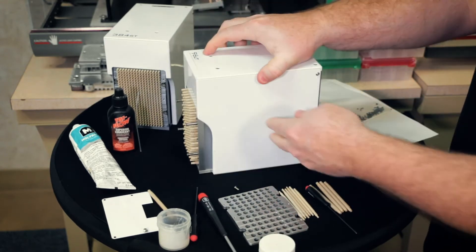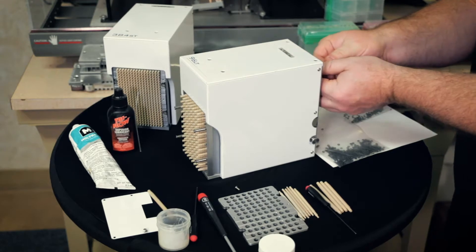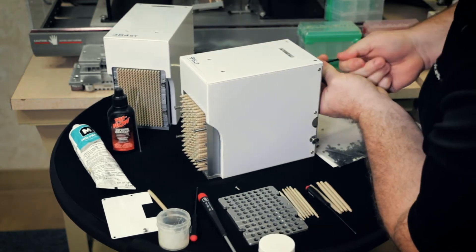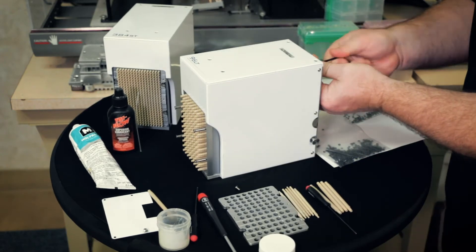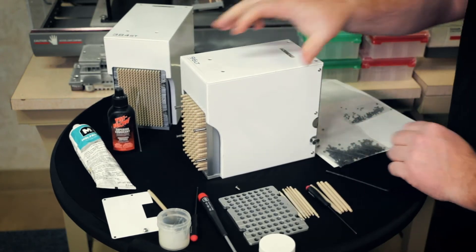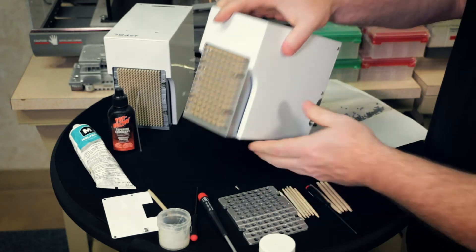We're going to want to go back and back the pistons off. Just maybe ten turns, five to ten turns. The reason why we do this, we want to put the stripper plate back on.